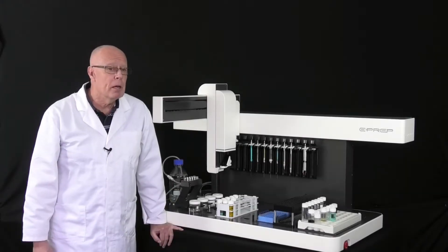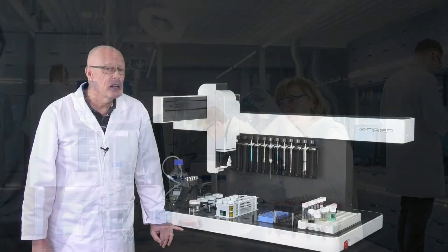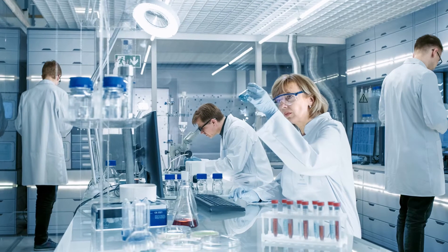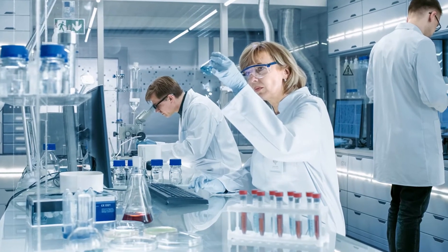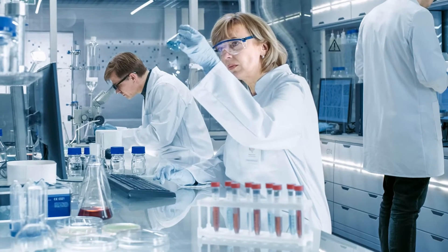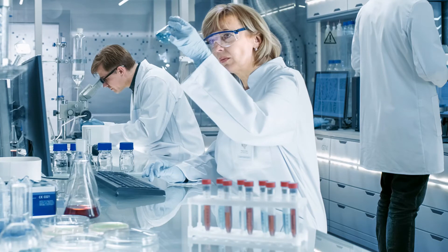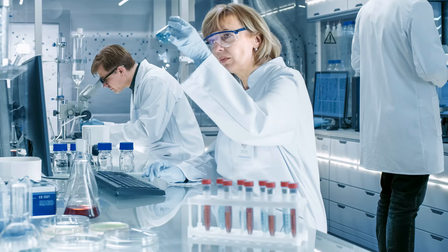Let's have a think about manual preparation and its pitfalls. Carrying out a task manually is error-prone because unfortunately people make mistakes. This could be because the written directions aren't clear, the operator doesn't follow them exactly, or perhaps they're just having a bad day. Also, the operator is exposed to the chemicals and samples they are handling, so this raises occupational health and safety issues as well.